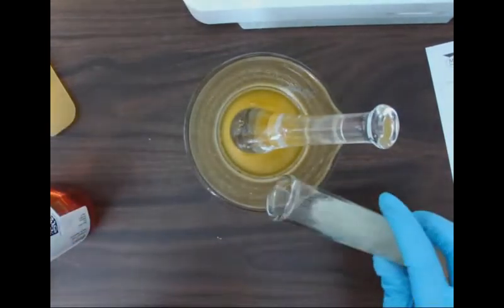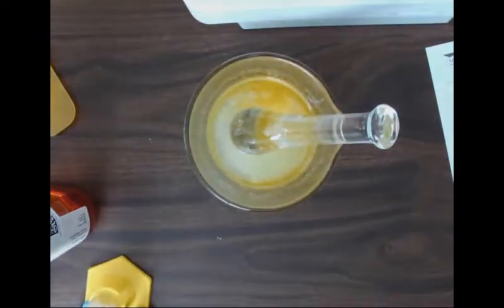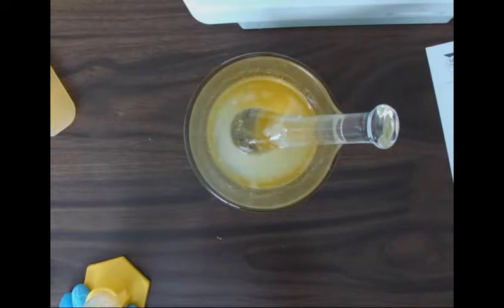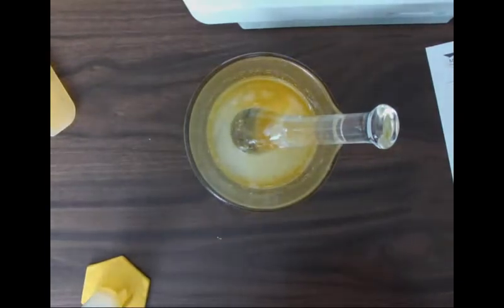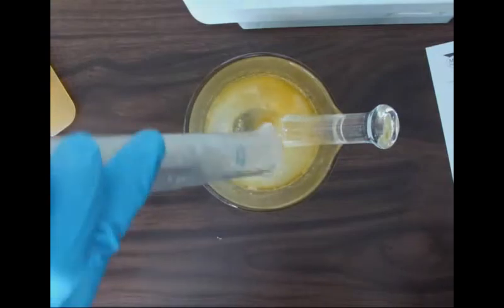Usually when I compound that, I keep it in the fridge, or I measure it out and put it back in the fridge so that it stays liquid and I can pour it out. Your formula there asks that you weigh it out, so you could do this in a weigh boat as well. Some formulas will give you a milliliter amount as well. I didn't have a scale at home, so I went for what was closest in milliliters to make this work.